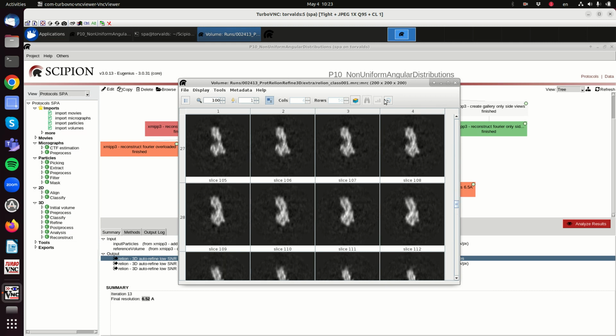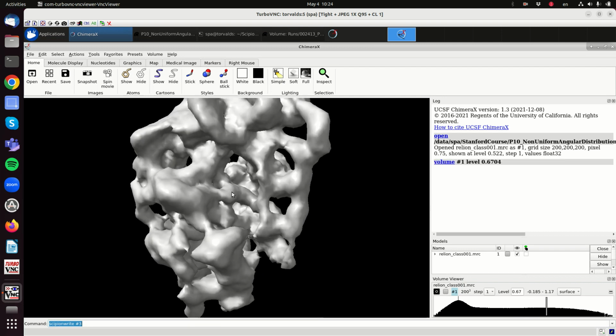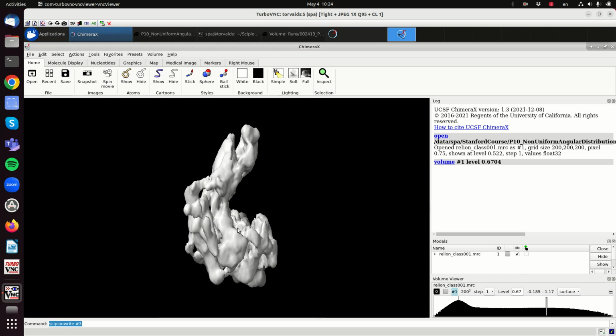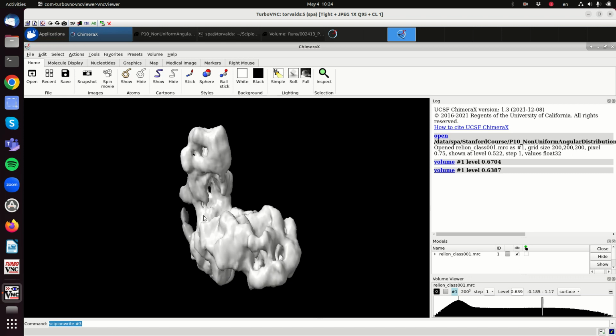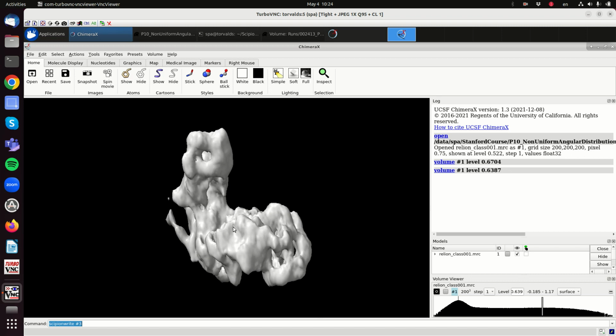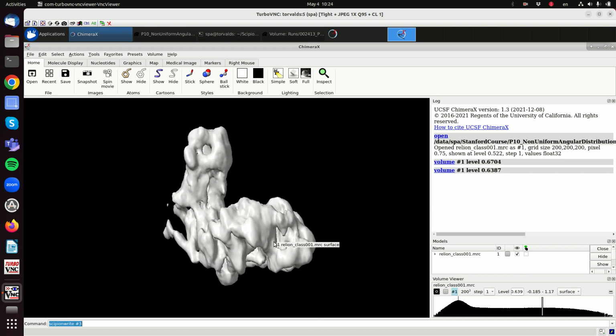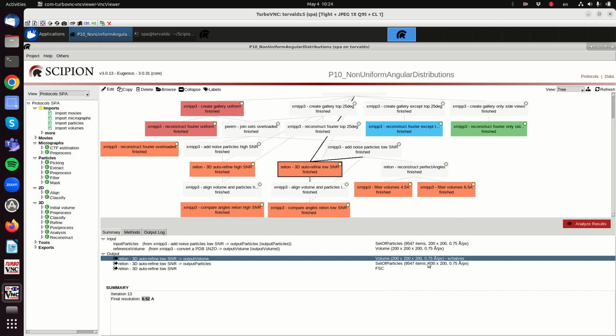So now if we look at it in 3D, this is our structure. So you see we have this elongation problem again. The elongation problem is actually an interplay between estimating angles and having low signal to noise ratio and having overloaded directions. These overloaded directions will tend to attract particles around, so more particles than actually come from the top view are estimated to be there. So we can see that in the angular distribution.